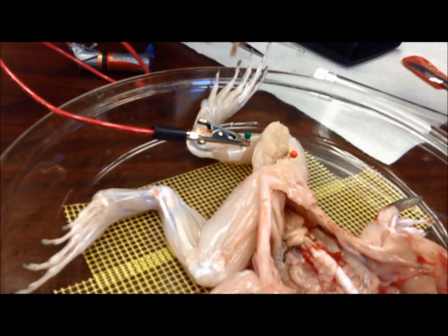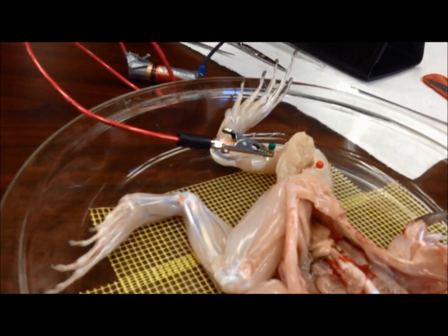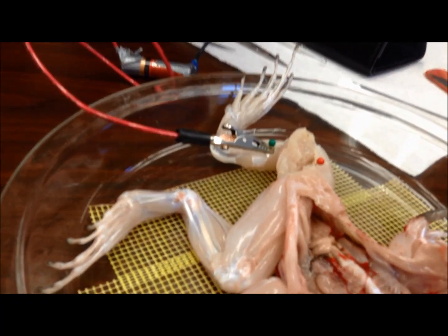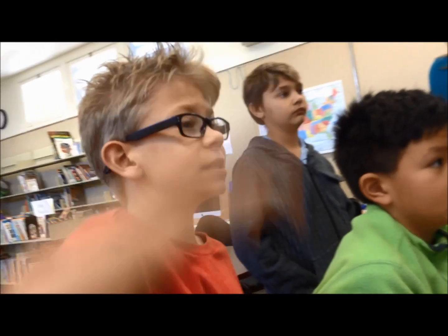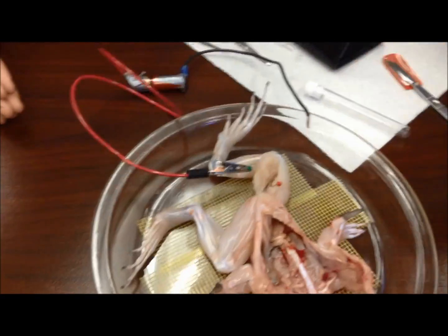Let's try it again. Dave, would you mind grabbing the salt? Let's see if that helps. Why do you guys think salt will work if we put some salt on? Oh — it's sodium! The sodium gives off energy. In a way, right? It does. What it does is it helps action potentials to happen in your body, to be more precise.